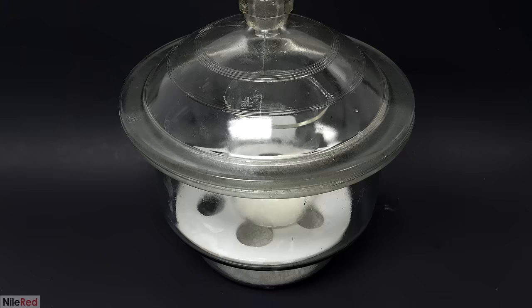I occasionally shook them over the course of the day, and I was eventually left with this nice spectrum of colors. What was also interesting was that the fluorescence changed as well, and this was what it looked like under a UV light. The question now though is why does the color change?